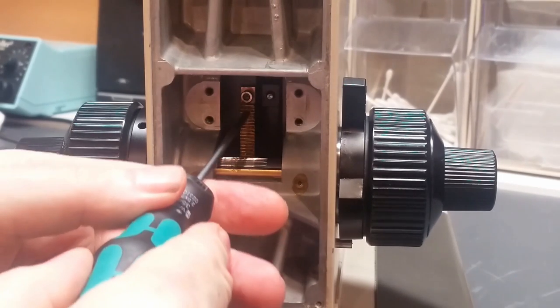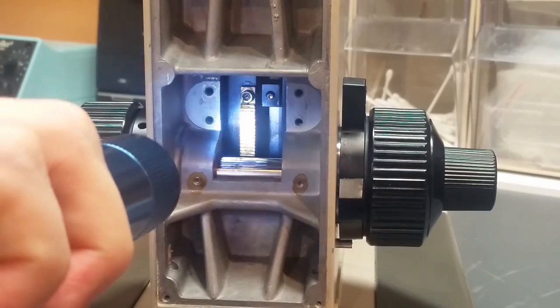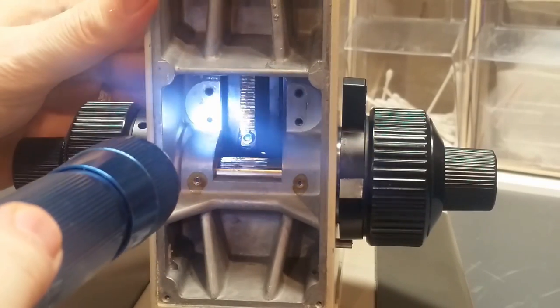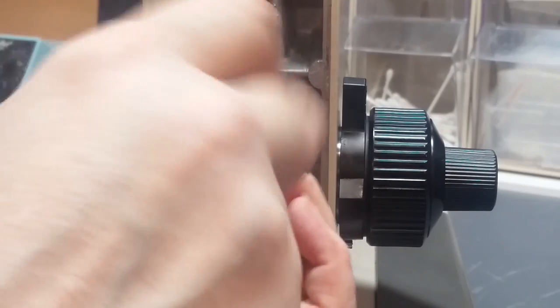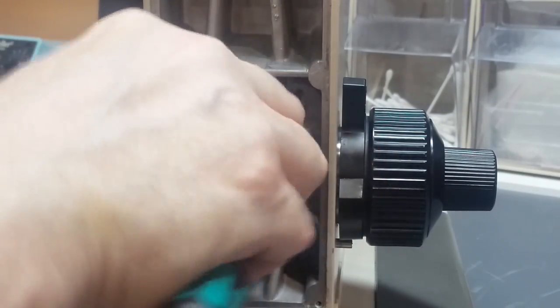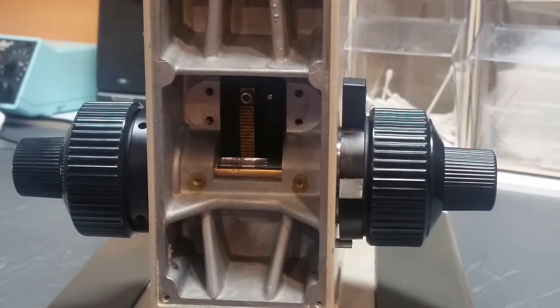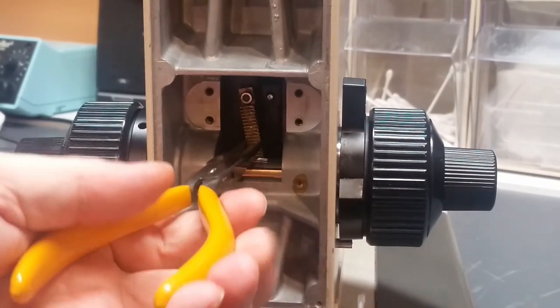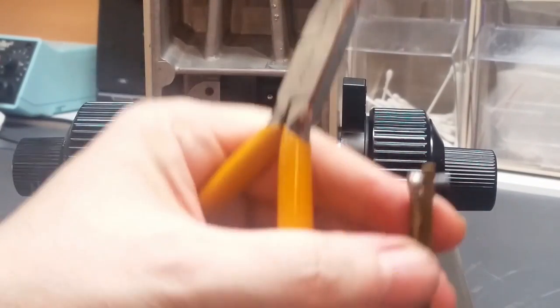Okay, step three now is the removal of this brass rack in here. It's a rack that meshes with the pinion. It's part of the rack and pinion assembly. And it's held in place by a socket head cap screw on the top and one on the bottom as well. Take the 2.5mm hex tool. I'll go in there, loosen and remove. At this point, I'm just going to loosen the top screw. And down here, I'm going to loosen and remove the bottom screw. And what I want to do is grab me a needle nose pliers just to hold this thing so that it doesn't fall out of place. And take her out. And that's how you remove the focus rack.